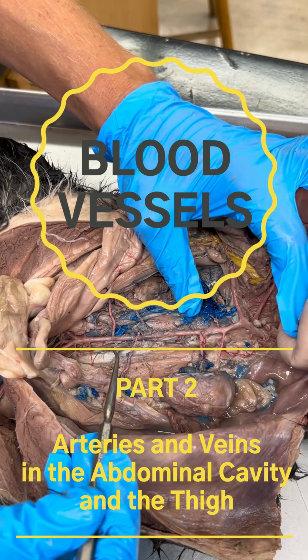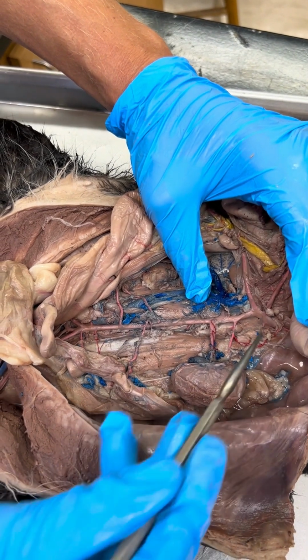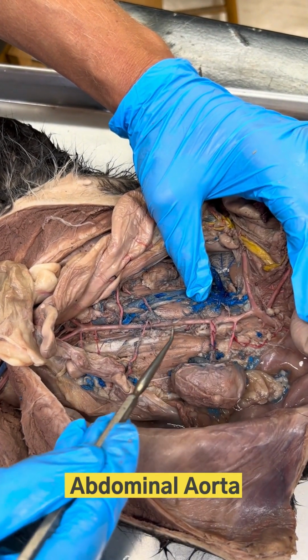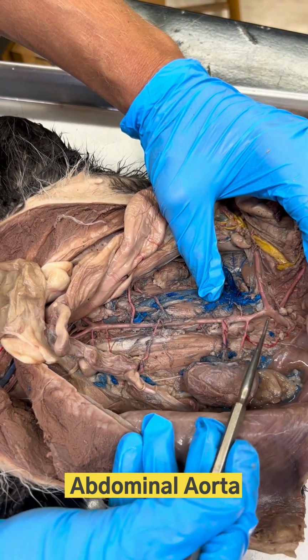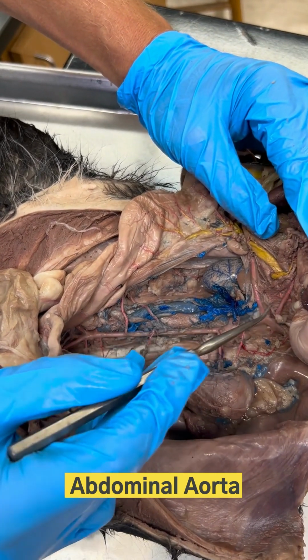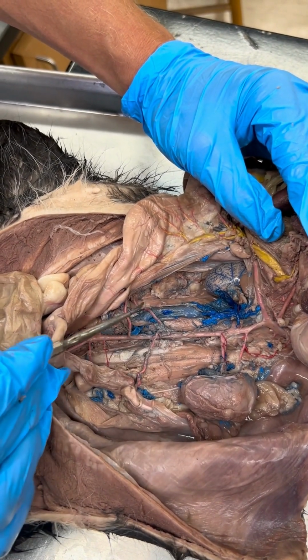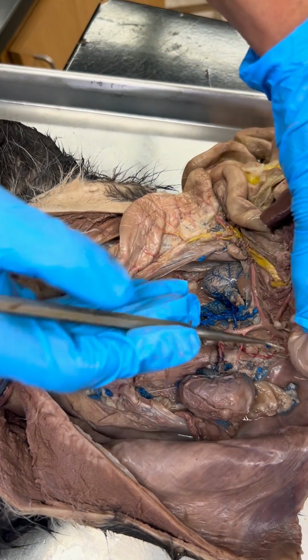So let's go ahead and now focus on the arteries found in the abdominal cavity. And so notice there's one large artery that runs the full length of the body cavity, and that is going to be the abdominal aorta. Along its length, it's going to send off various artery branches to supply blood to different organs. And so let's name those various branches one at a time.